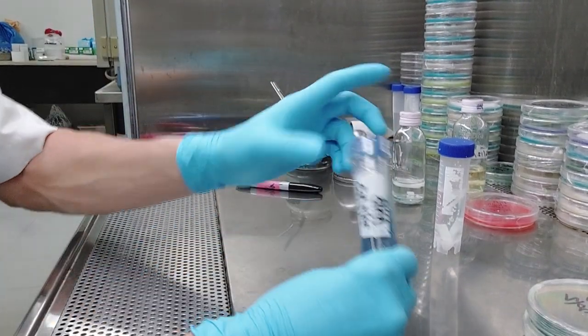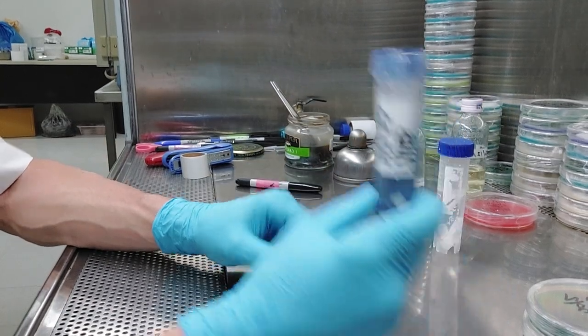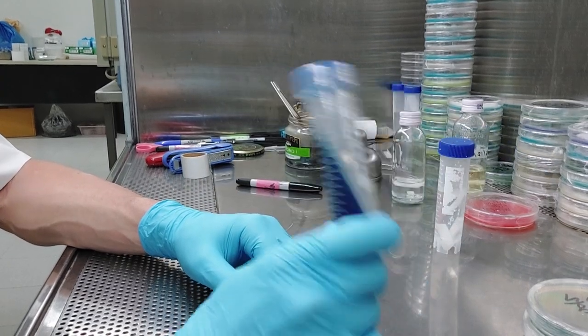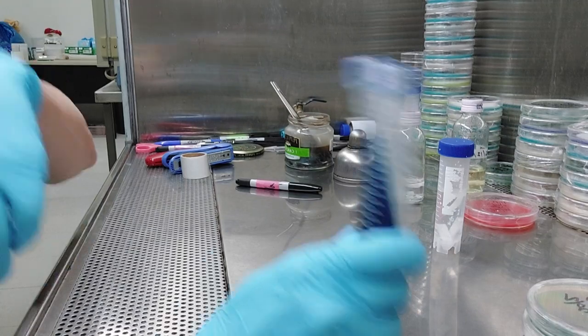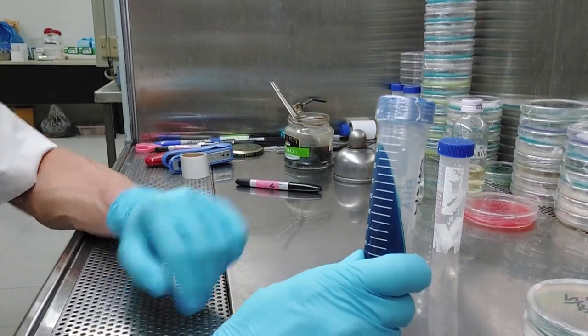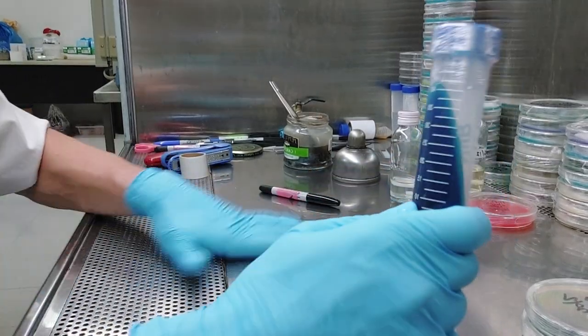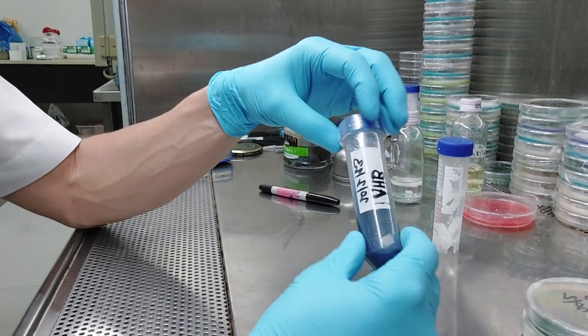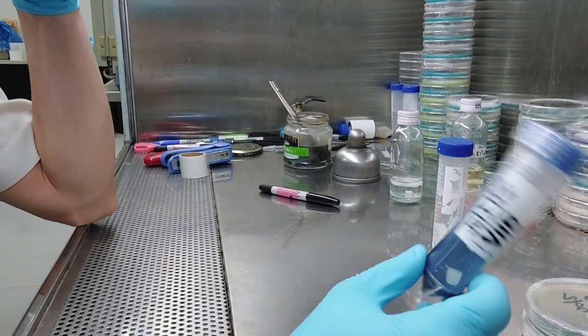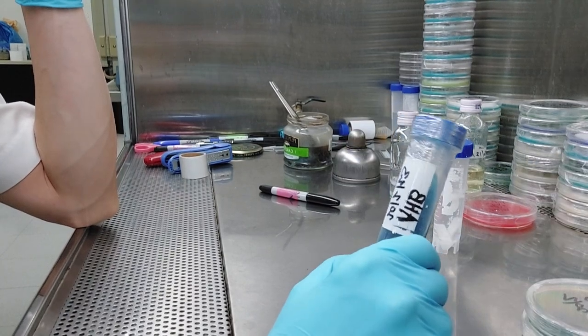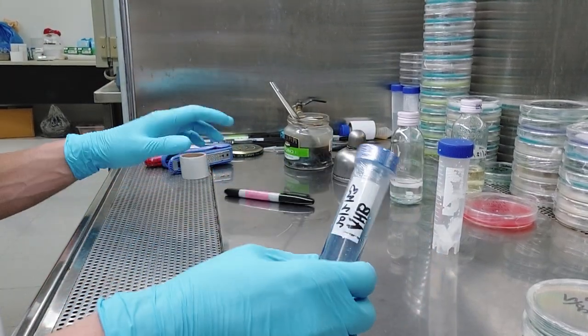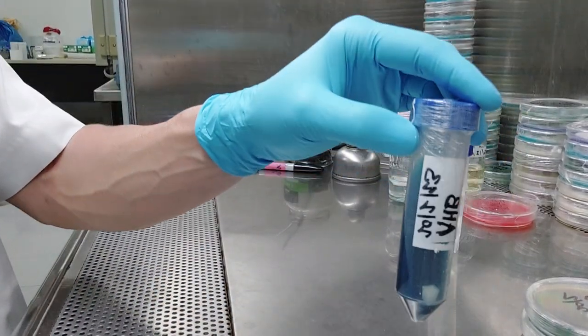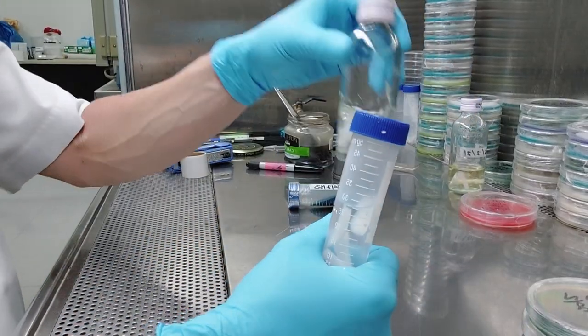I think that's it you guys. Oh, culture storage. Keep these at room temperature. If you want to, you throw them in the fridge. Again, the jury's kind of out on that. Tropical cultures in a refrigerator. I believe if they're kept at four degrees Celsius, which is about 40 degrees Fahrenheit, which is your typical domestic refrigerator, they should be fine. I don't see any reason why there's been old myths about like, oh, it will kill the pans and it'll kill tropical ones. I don't believe any of them. Like a lot of things in this hobby, you know, there's old wives tales or whatever myths, whatever the PC term is for them now. Anyway, room temperature or refrigerator, this room temperature, room temperature.